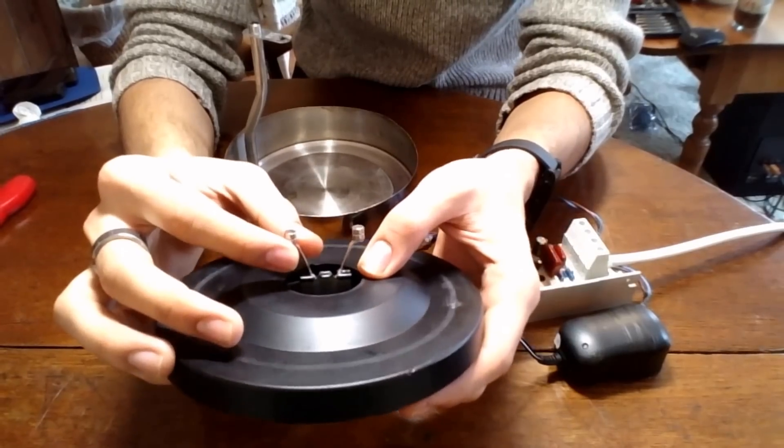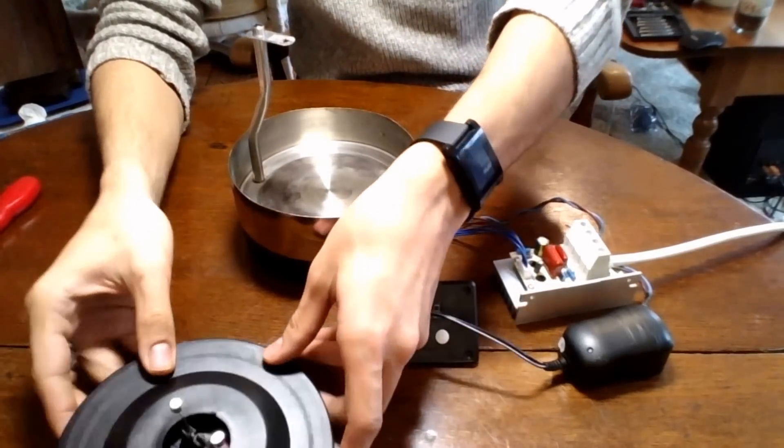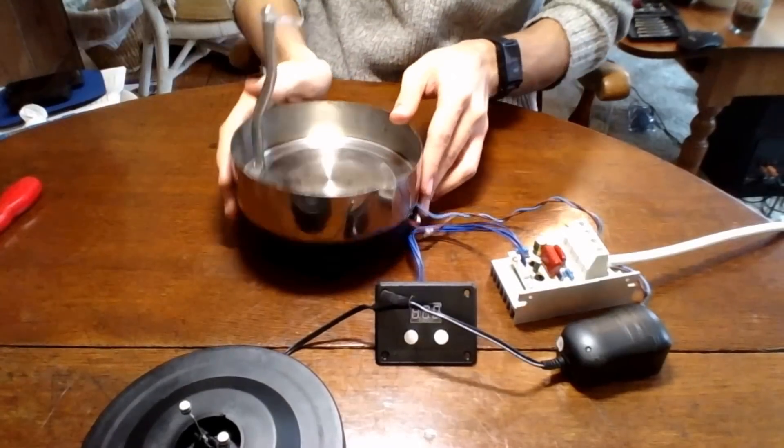I've super glued my magnets in, just to give them a good base, and here's our hot plate.